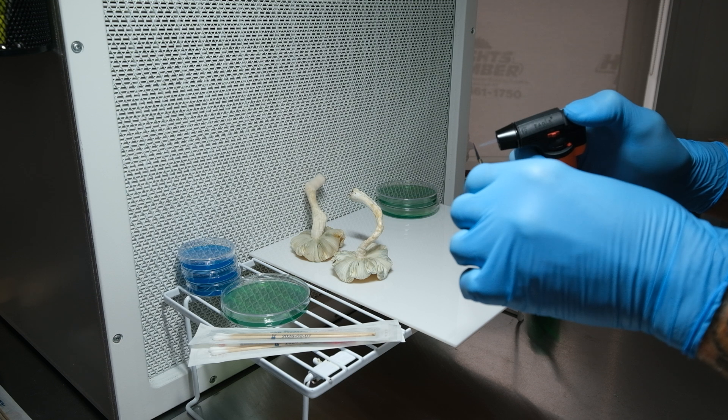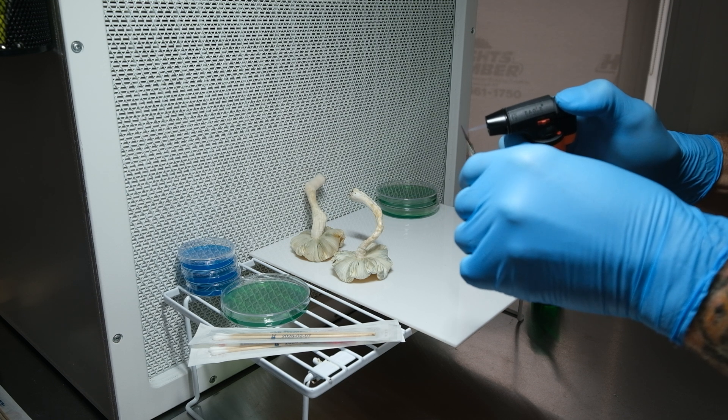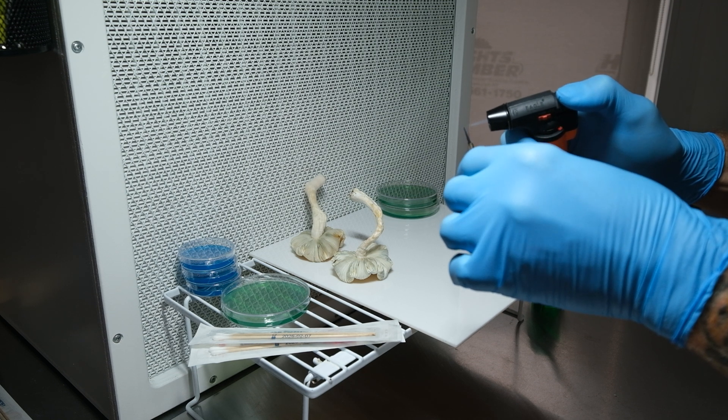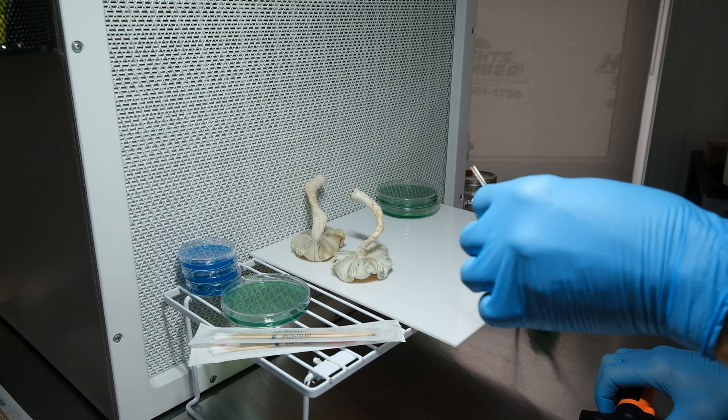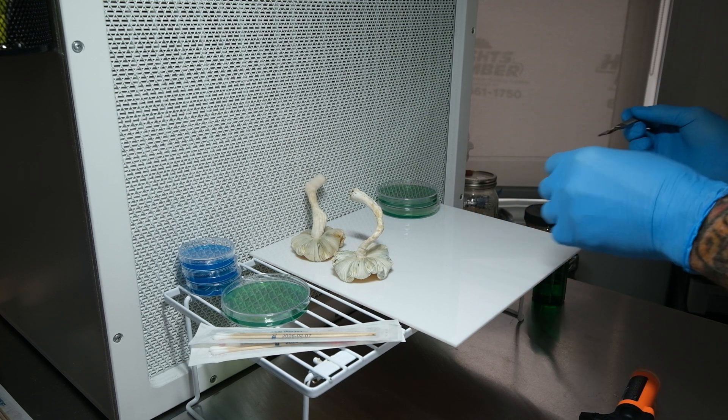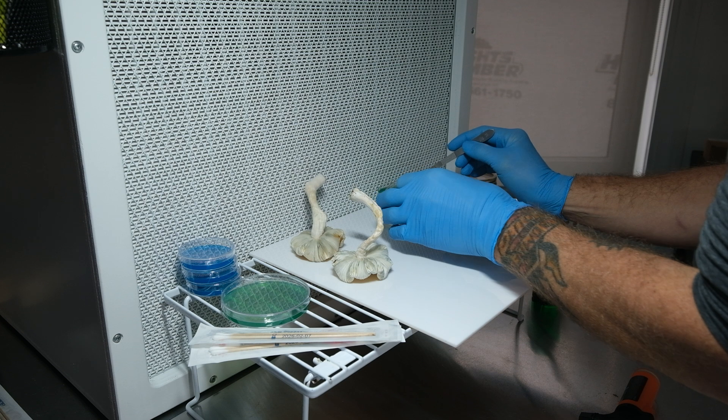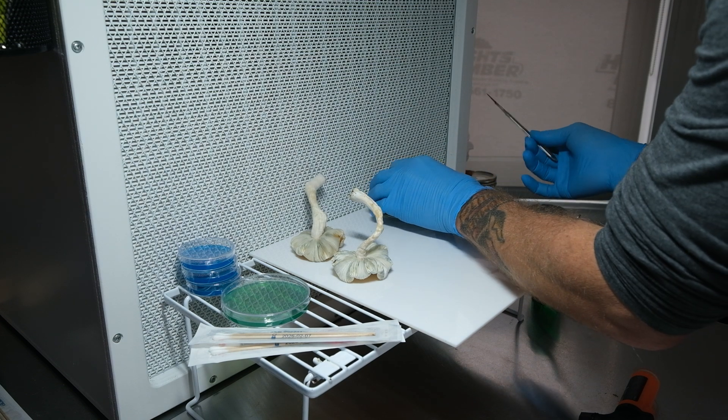Like I said, check out my Patreon if you want more details on that. But right now I'm gonna take a couple tissue samples real quick, one on each fruit.